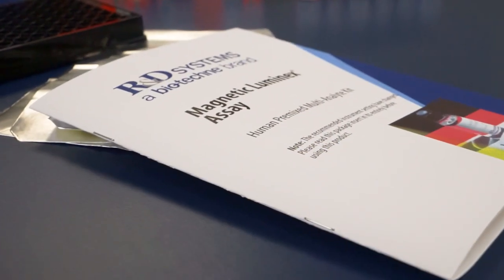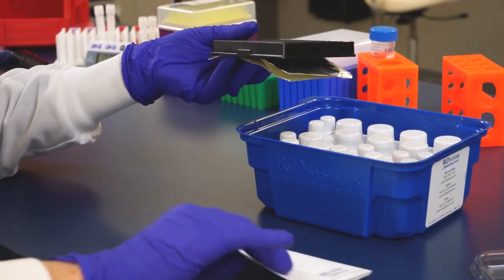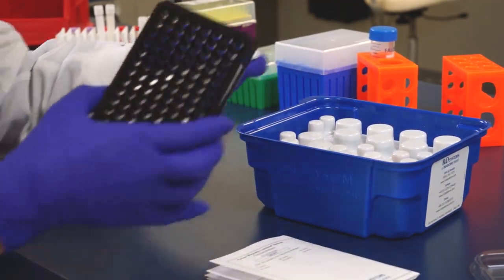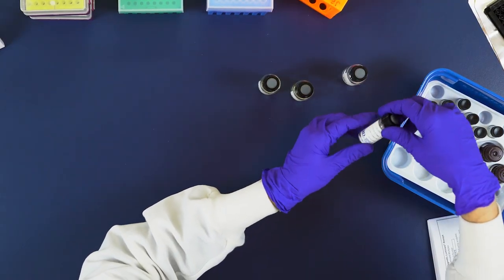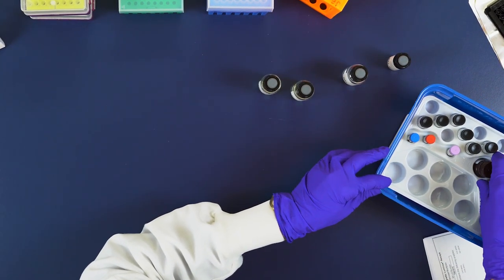In this video, we're running a magnetic human premixed Luminex assay. Standard and high-performance assays differ, so refer to your kit booklet throughout this video for specifics. This kit is for research use only and not for use in diagnostic procedures.